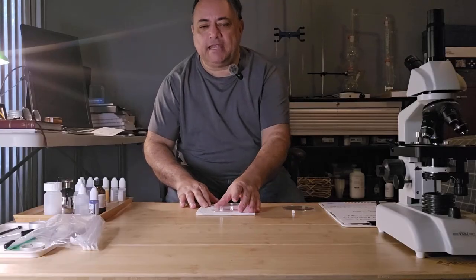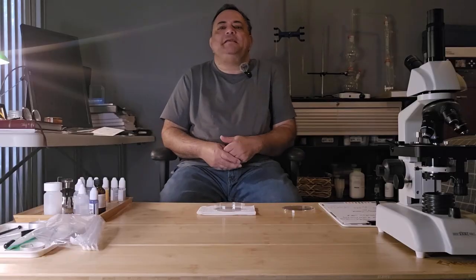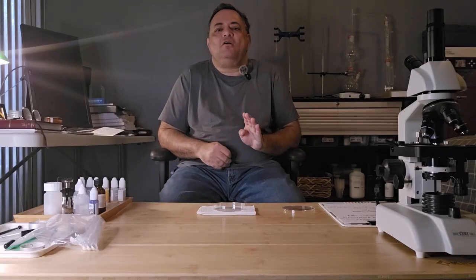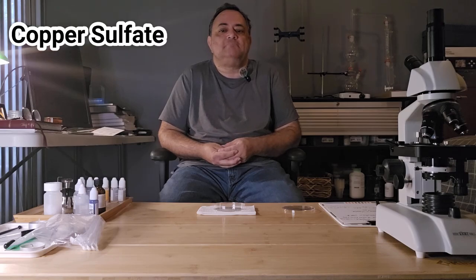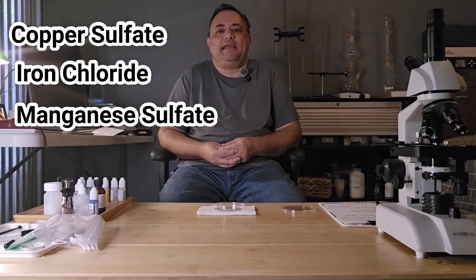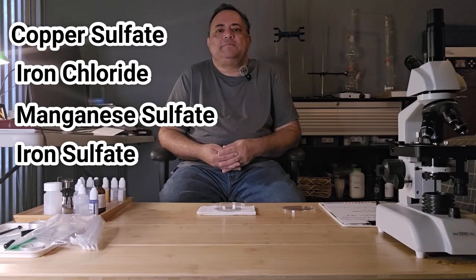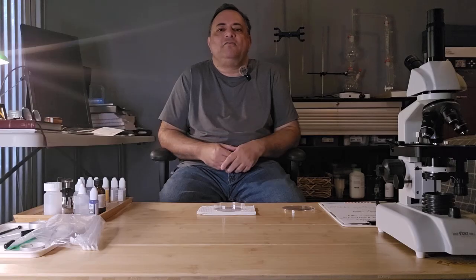So today's reaction is going to take place in a petri dish, and we're going to be using 4 different metal salts to demonstrate this reaction. We're going to be using copper sulfate, iron chloride, manganese sulfate, and iron sulfate. So let's start the experiment and then we'll come back for an explanation.